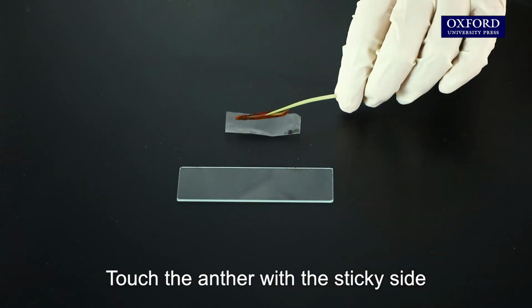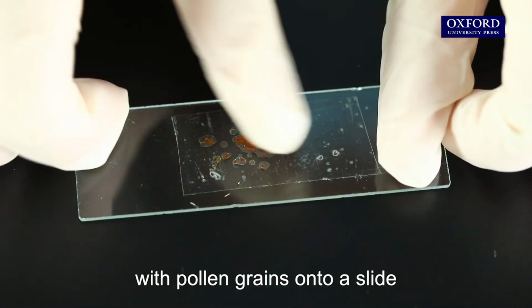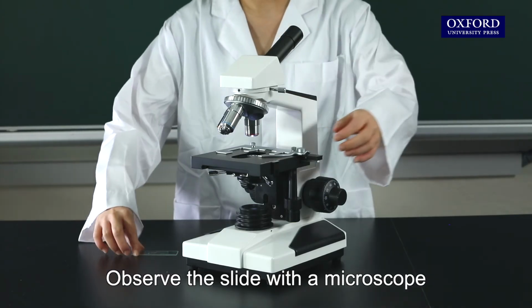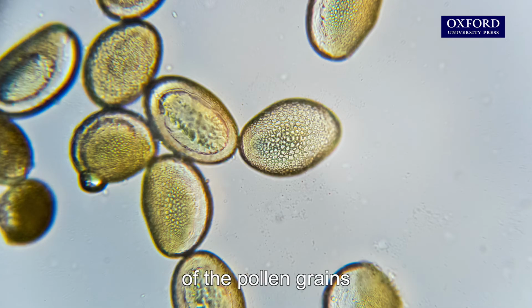Touch the anther with the sticky side of a piece of sticky tape. Stick the piece of sticky tape with pollen grains onto a slide. Observe the slide with a microscope under high-power magnification. Draw a labeled high-power diagram of the pollen grains.